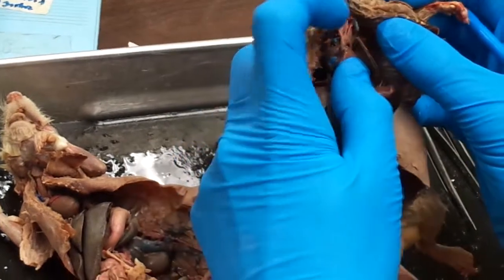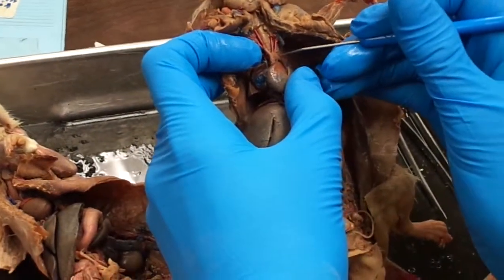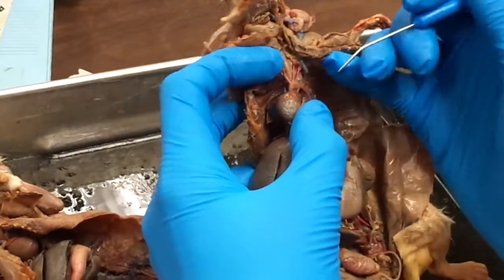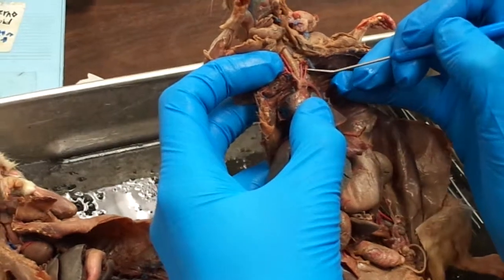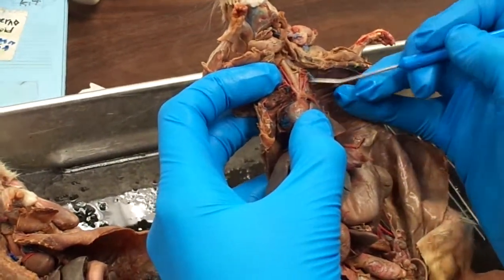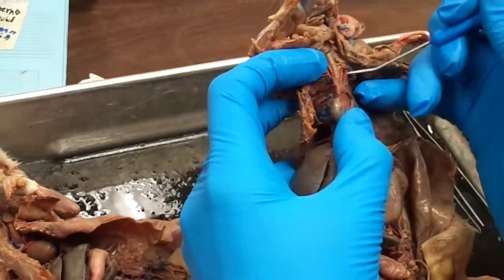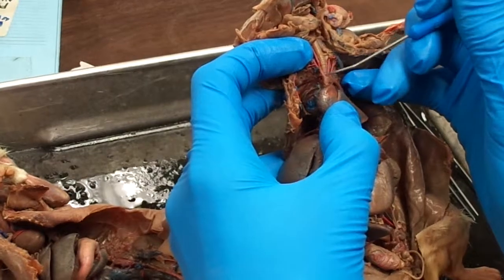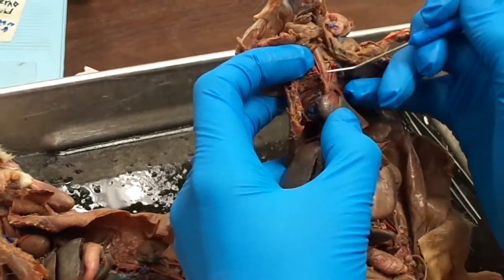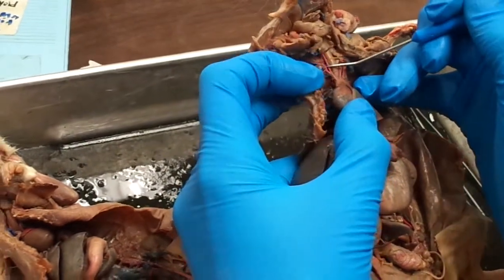Now back up here at the heart, starting on the left side, the very left side of the aortic arch, the first one you'll have is the subclavian artery. It's going to run into the body wall, as you see right there. Next will be your left common carotid artery. And on the right side, we have the brachiocephalic trunk, which goes to right there, just that little region, where it splits off for the first time with your right common carotid artery.